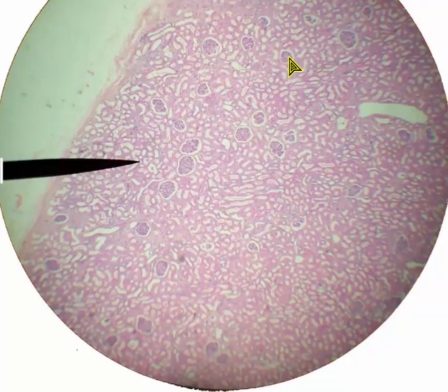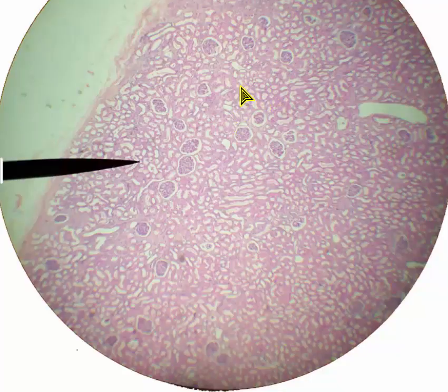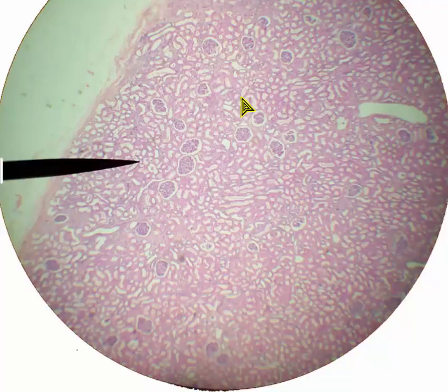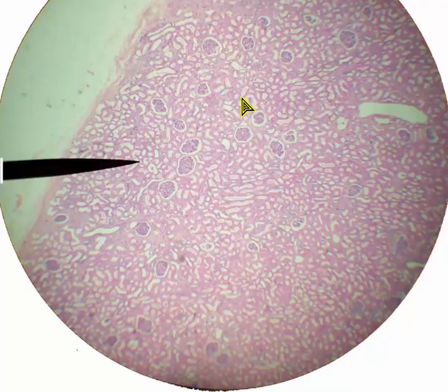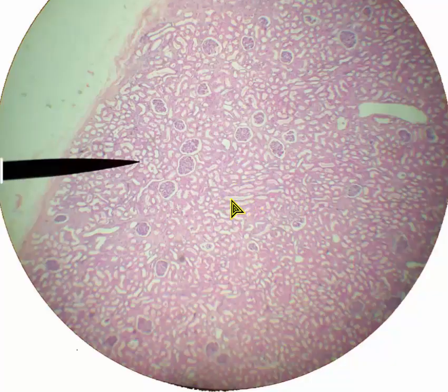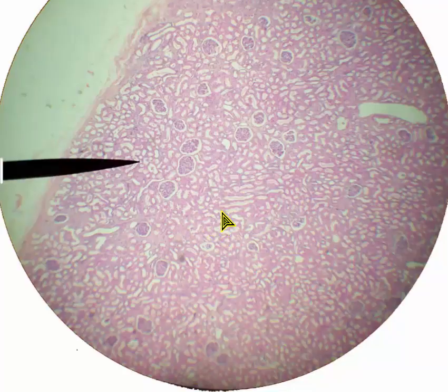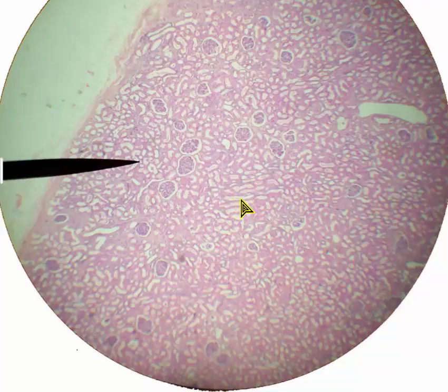Renal corpuscle, renal corpuscle, renal corpuscle. In between the corpuscles, what we're seeing are renal tubules. Those renal tubules have all different kinds of shapes here because the proximal and distal convoluted tubules are just going in and out of this one or two dimensional slice taken through the kidney. Sometimes the tubules might look almost like a shepherd's crook, here it's like a short straight line, here's a longer straight line, and you see areas where they look like circles and areas where they look like ovals because they're making different turns in and out of the slice.